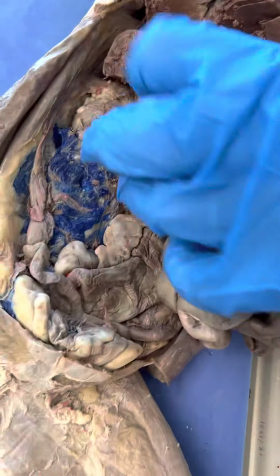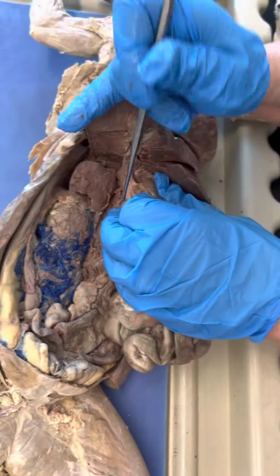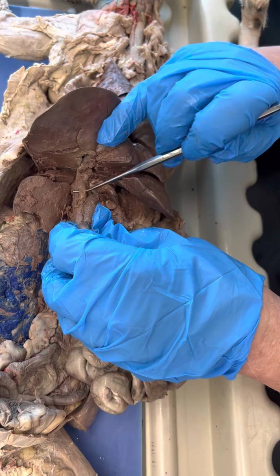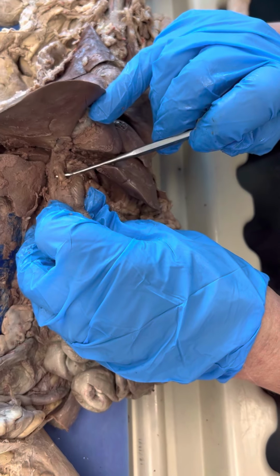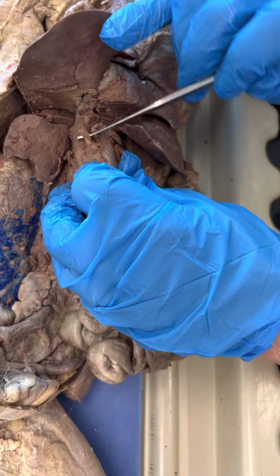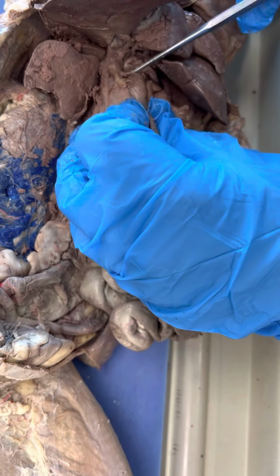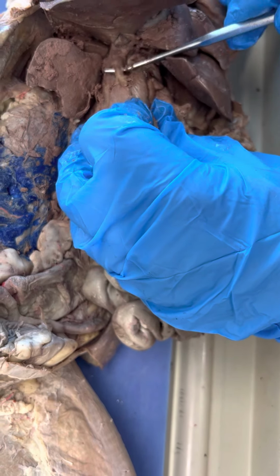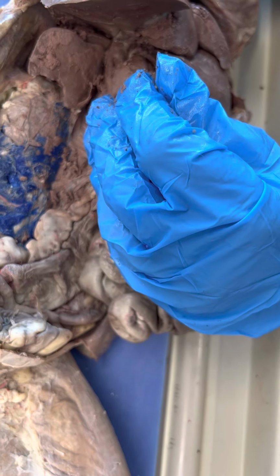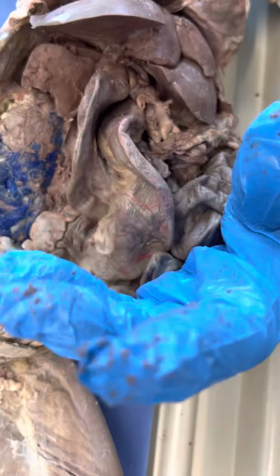So you've got to find the duodenum right here. I said you couldn't see it, but there it is. That'd be your common bile duct. I still think it would be on the model, but you see how all of these join together, and see where it's going right into the duodenum. I've never seen one that good before. Hopefully they won't find it. Okay, so we did the liver, we did the gallbladder.